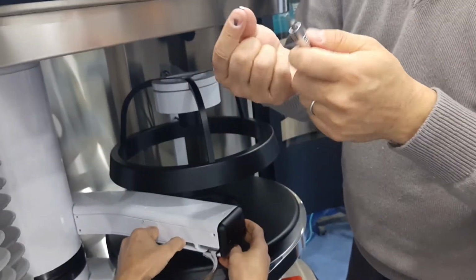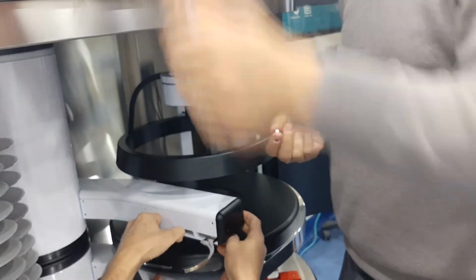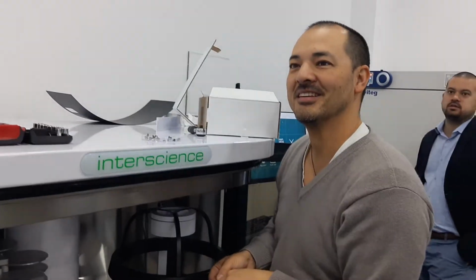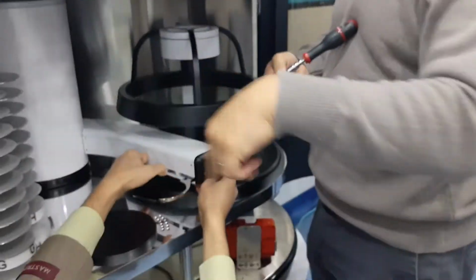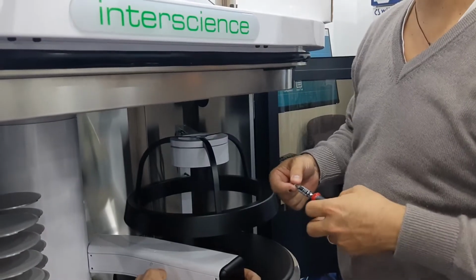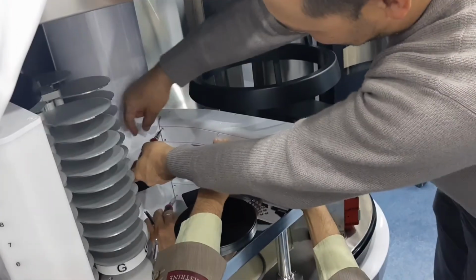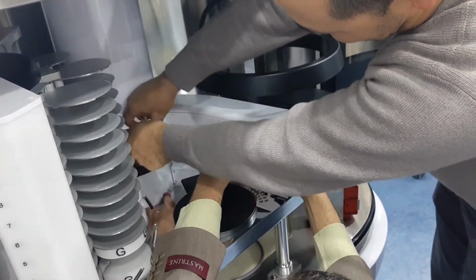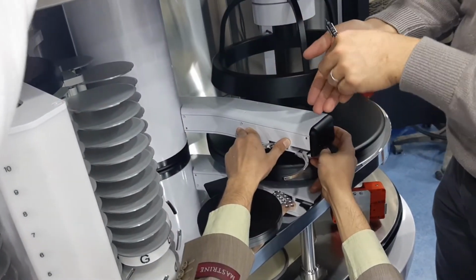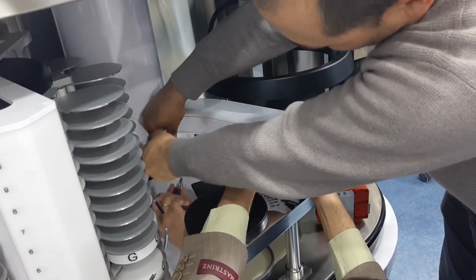Oh yeah, and all the screws are star shaped, and that's a little toolbox we have at the factory, and I think all the machine is made with only this toolbox. With one toolbox you can make everything. What I noticed is that the quality is not universal in the market. It's not the same. This is high quality. It's French made, I think. It's a very classic French brand, actually. But yeah, normally with these tools you can make everything, all Interscience machines actually.